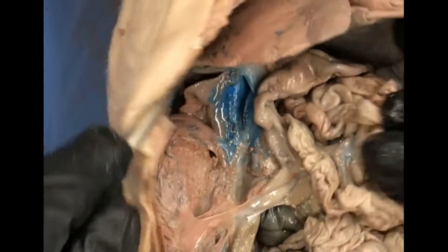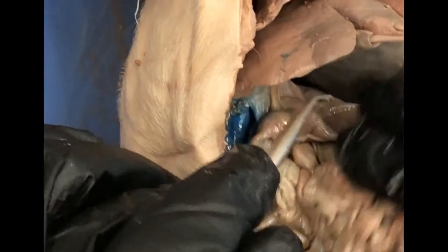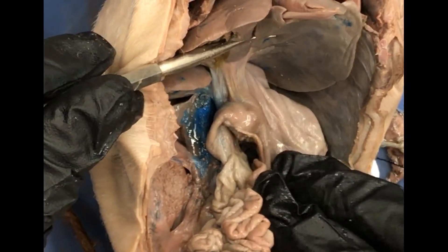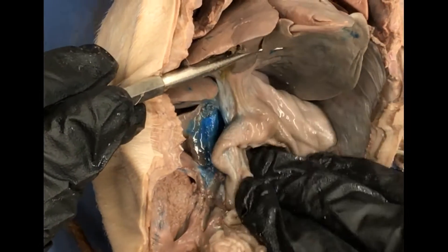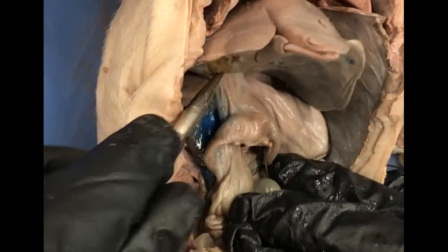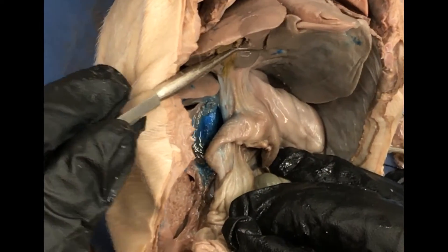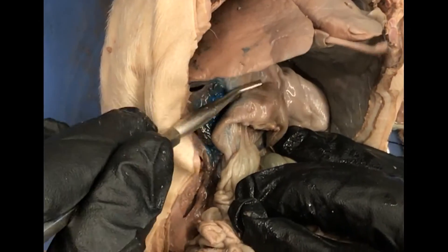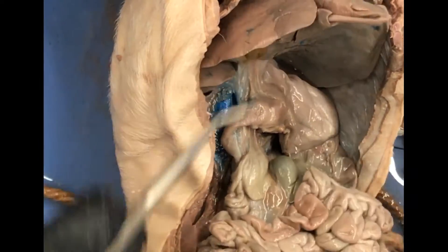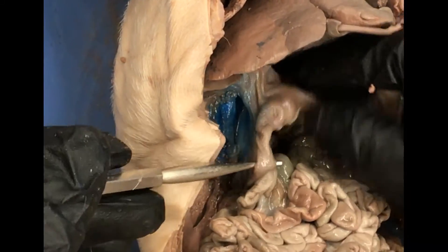Other things you can see in the abdominal cavity: there's the lesser omentum. See how it's holding the liver to the stomach and duodenum? That's the lesser omentum. There's the duodenum.